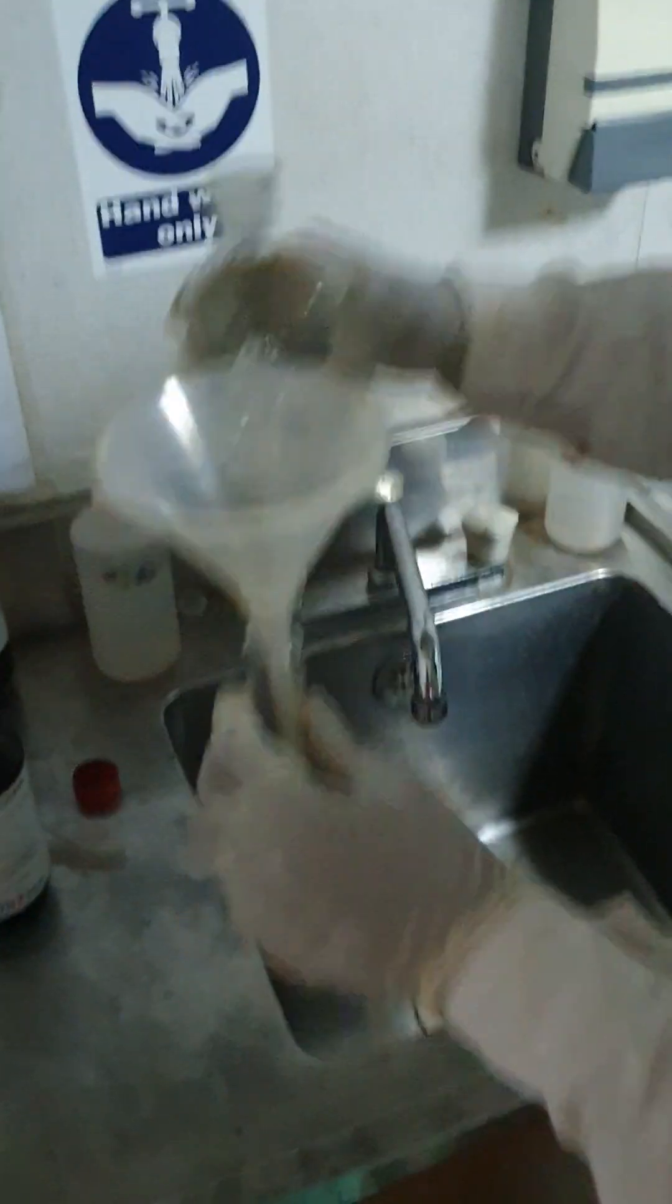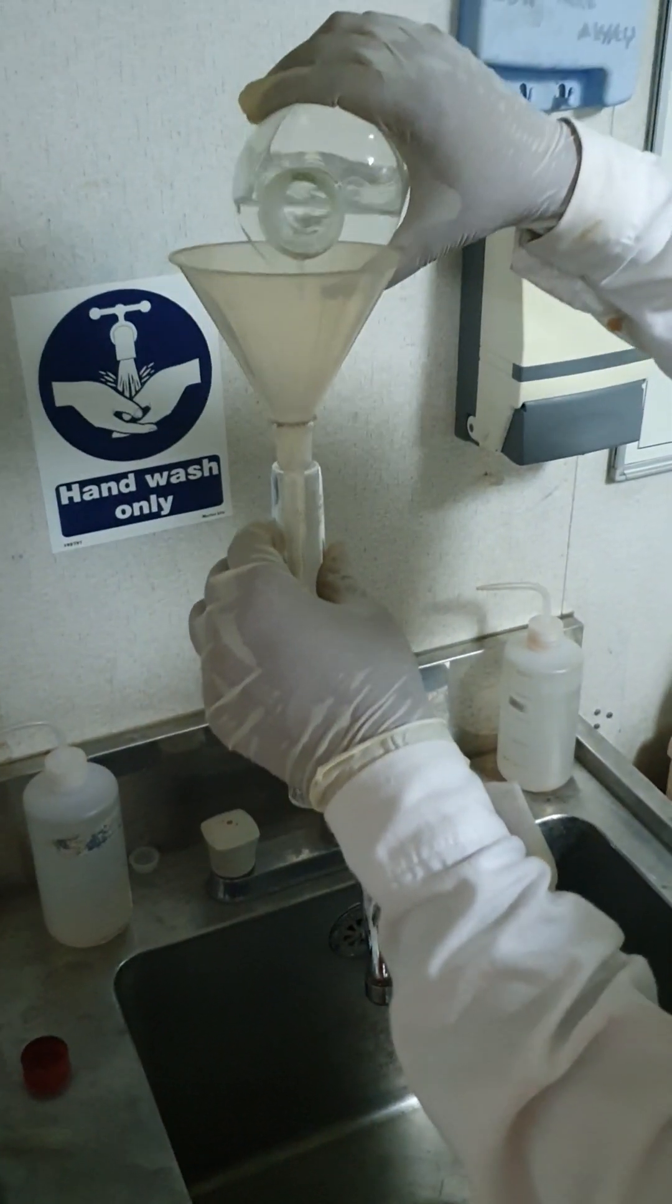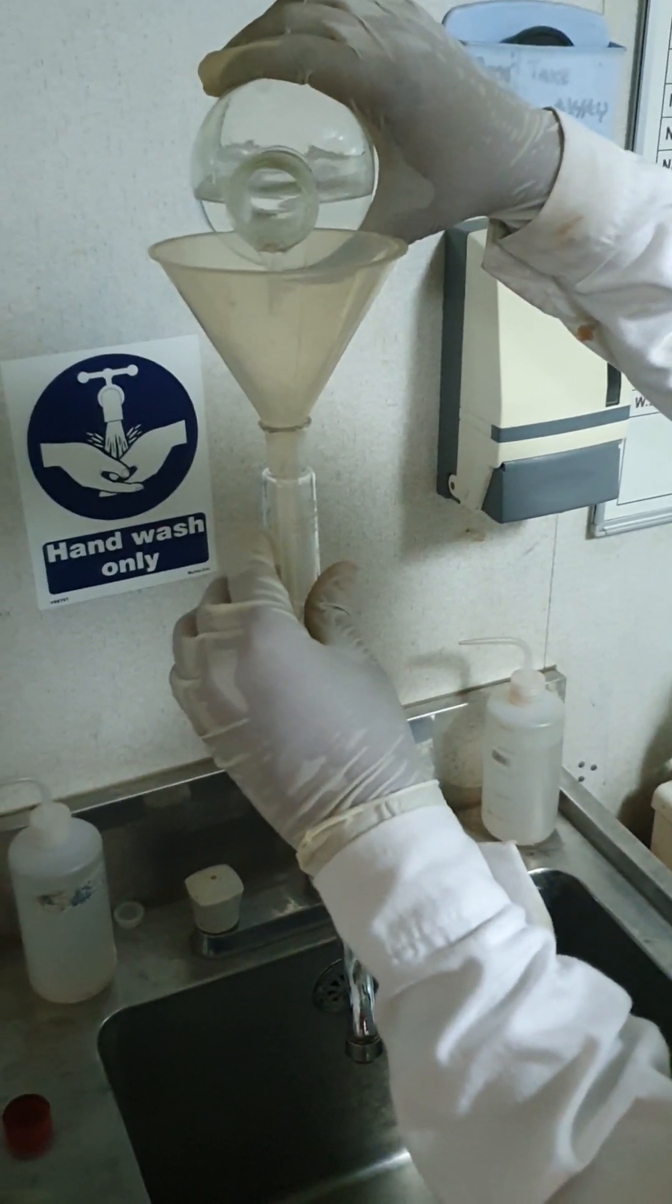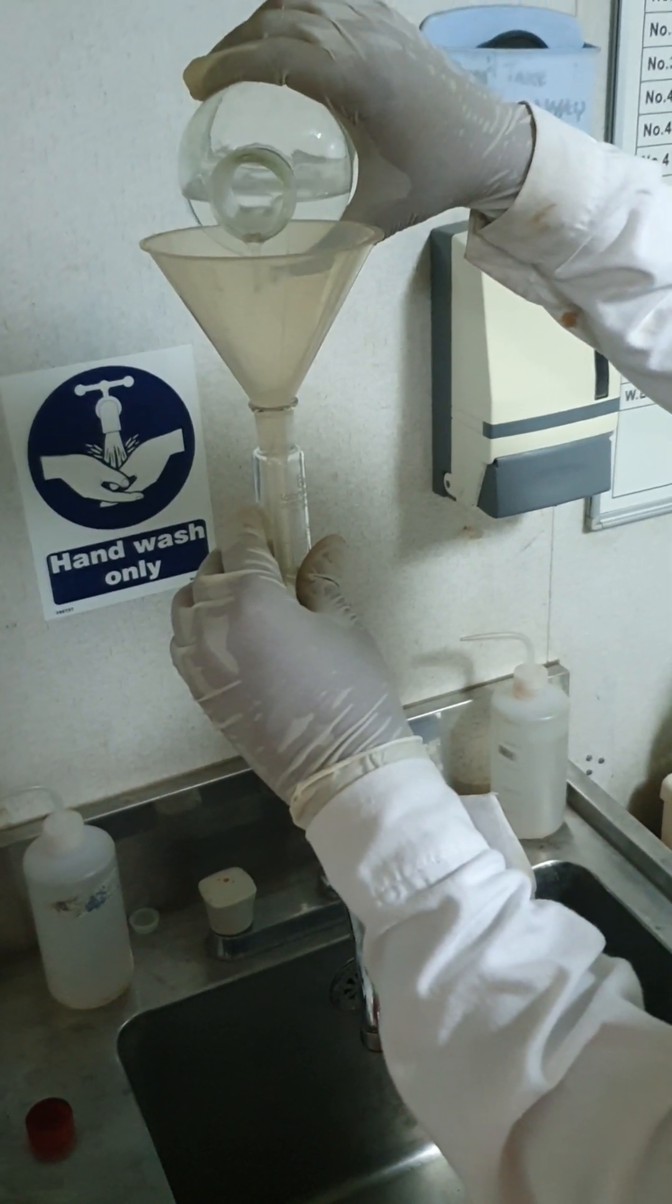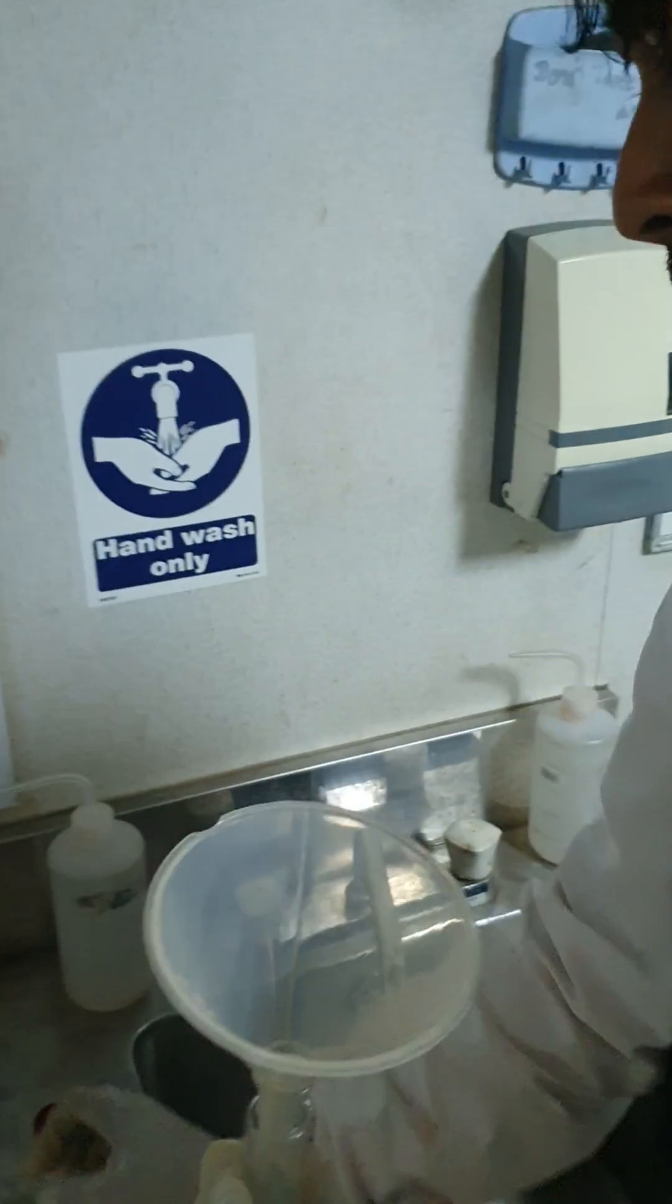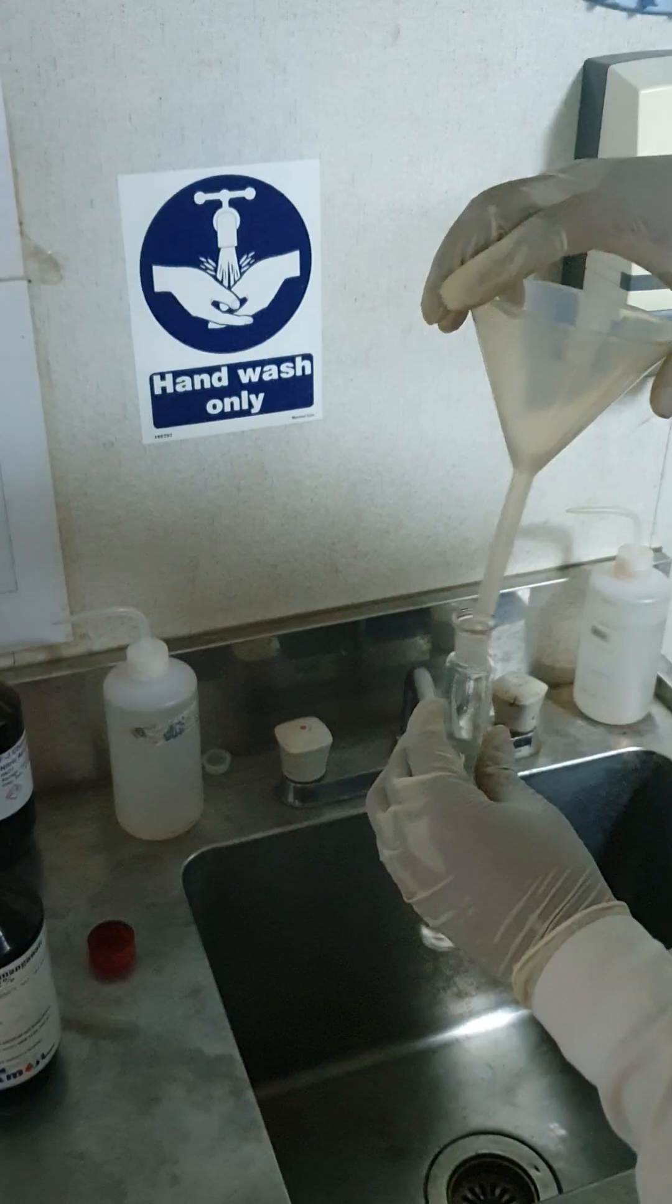Now we will show how to do the PTT test. We will take the sample 48cc from the Valor sample and 2cc of the PTT, potassium permanganate, KMnO4 of course.